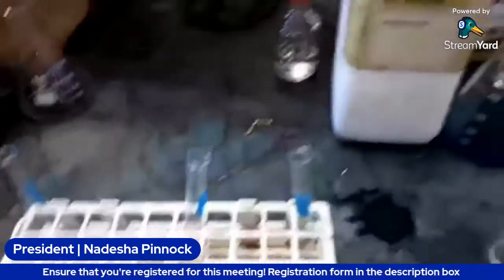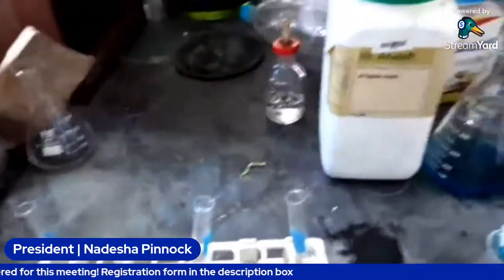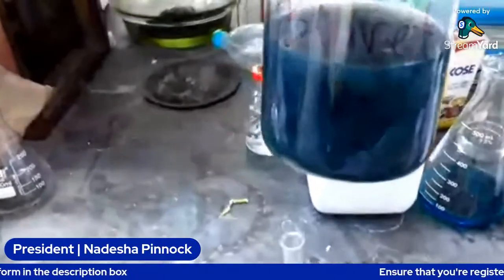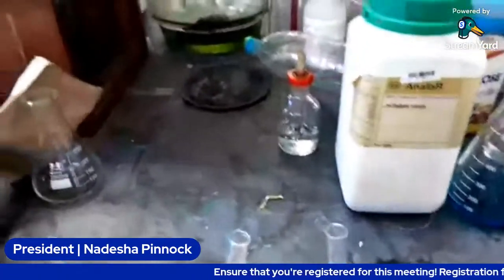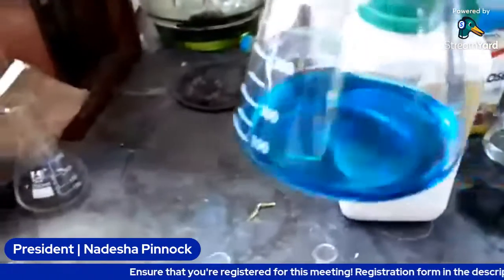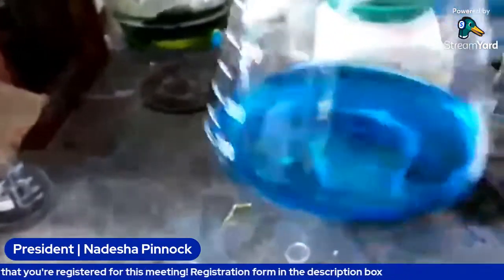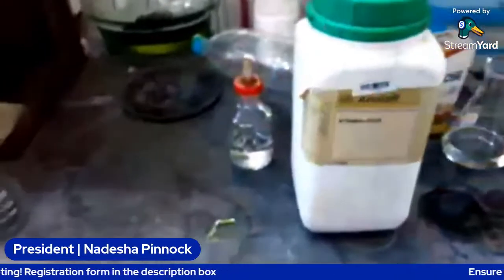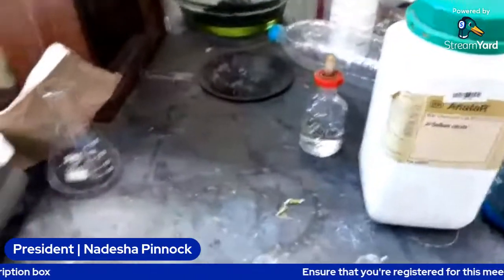And then this is our Biuret reagent. So just to note, initially it was this color. And remember, we said that the sodium potassium tartrate is used to chelate the copper ions, so basically to stabilize them.